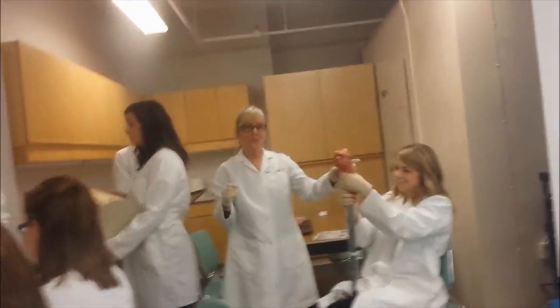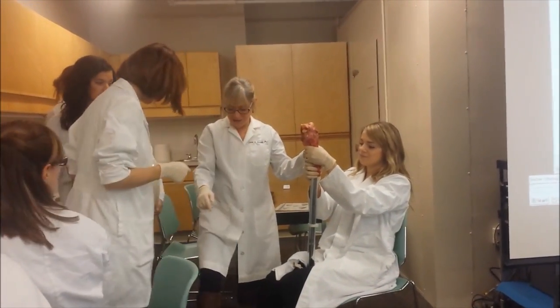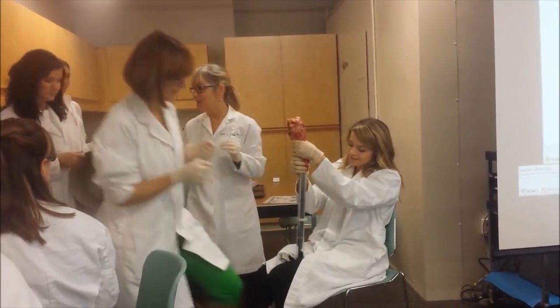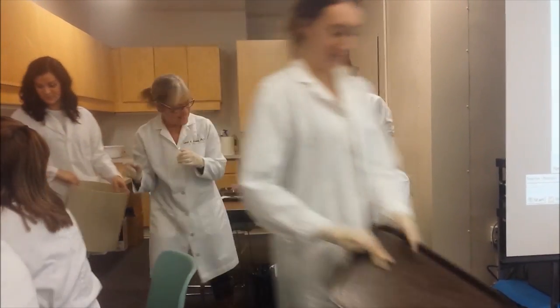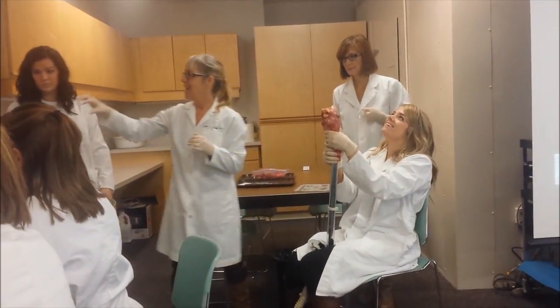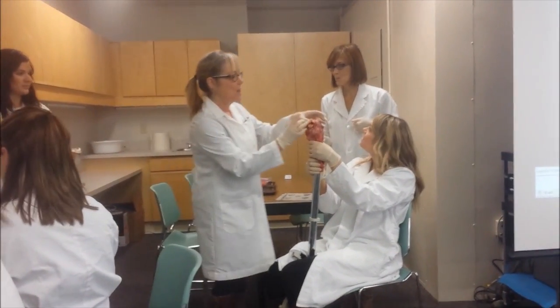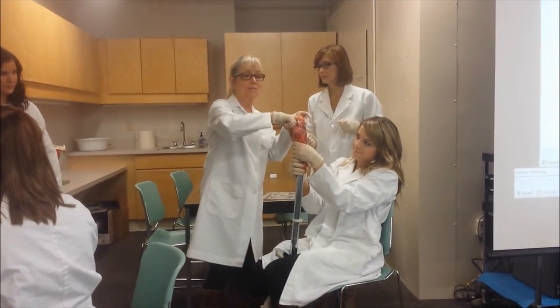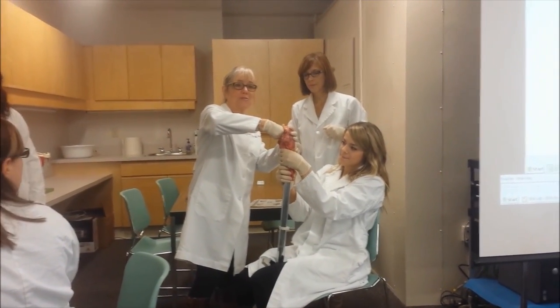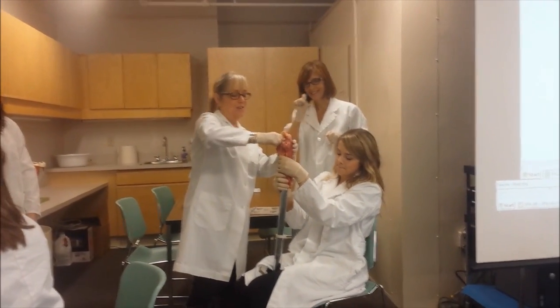The trachea is attached to the lung, which is the vacuum cleaner. We need a little Vaseline. I'm putting a little Vaseline into the vocal folds because this guy's been out for a while and has not been hydrating, so we need a good contact.